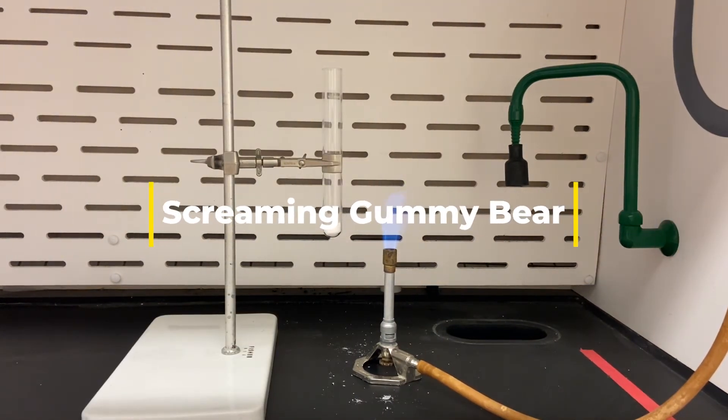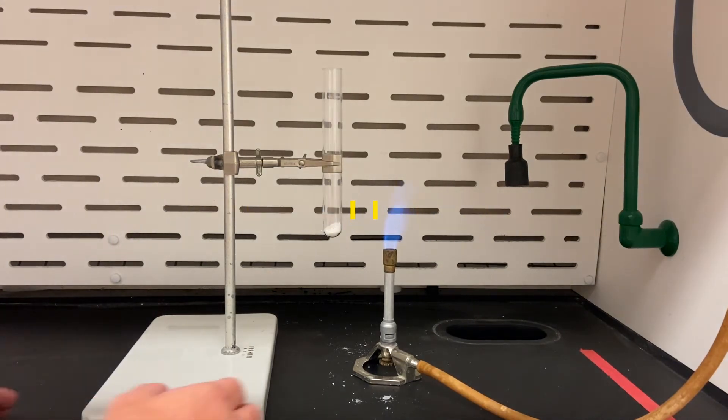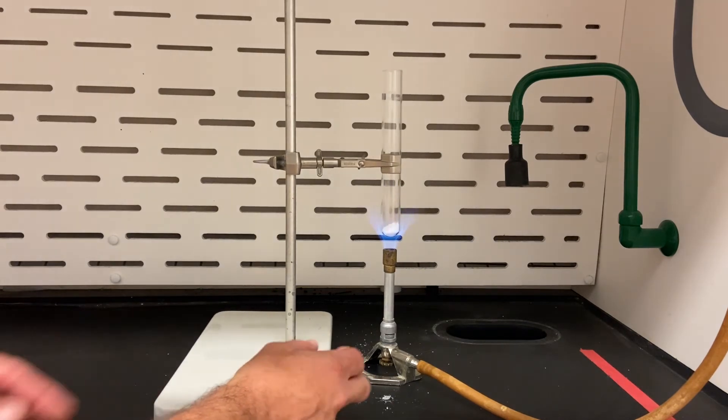Okay, here we go with the screaming gummy bear. So we're going to get our potassium chlorate melted again.